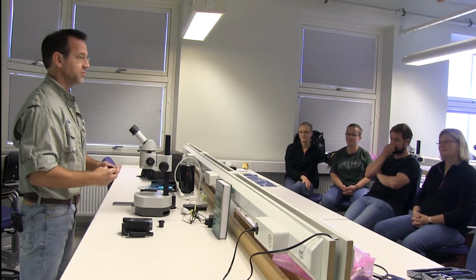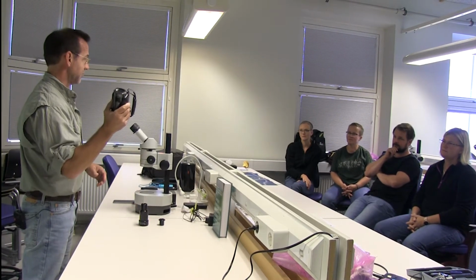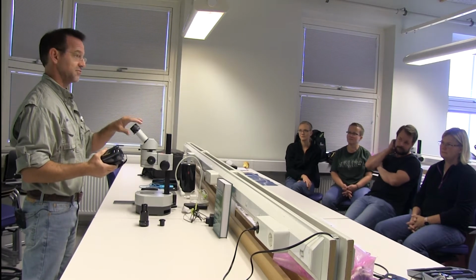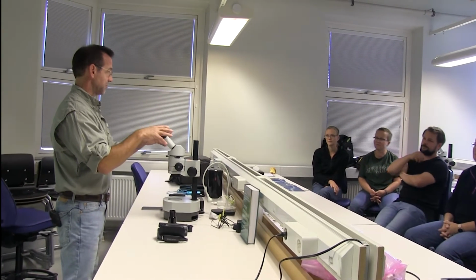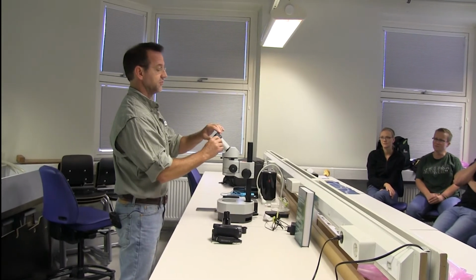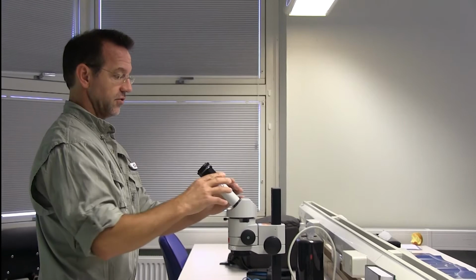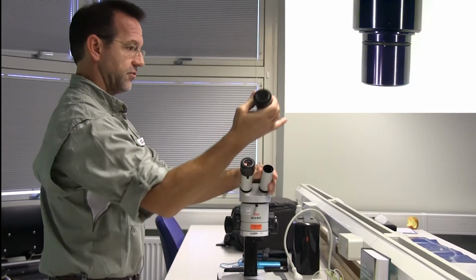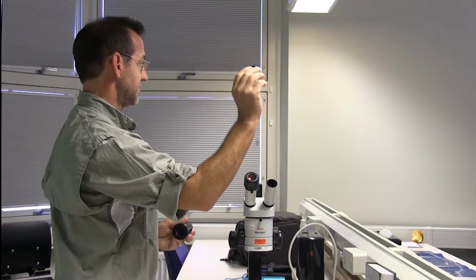This morning we're going to show you some of the technologies used to connect cameras, or video cameras, or your phone camera to the microscope. Most of you are familiar with a stereoscope or other type of microscope, and the first thing that you need to do is remove the eyepiece. So that's the key. So most microscope eyepieces are either 30 millimeter or 23 millimeter.